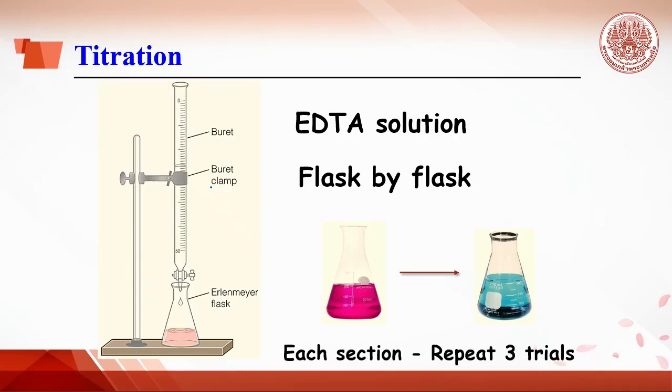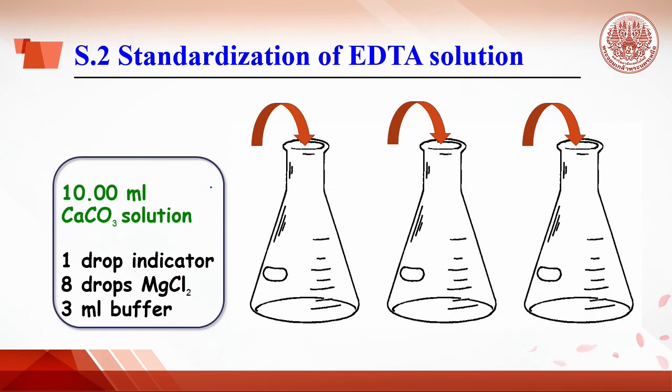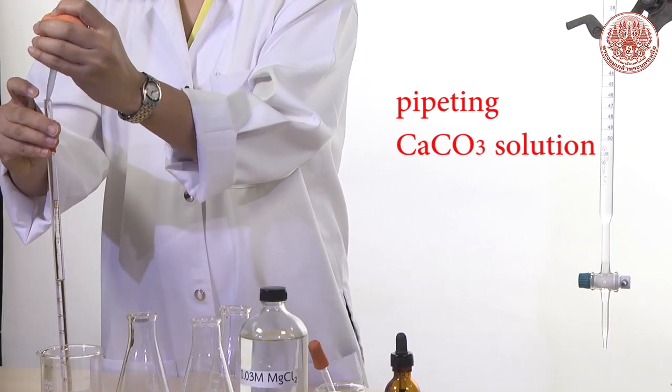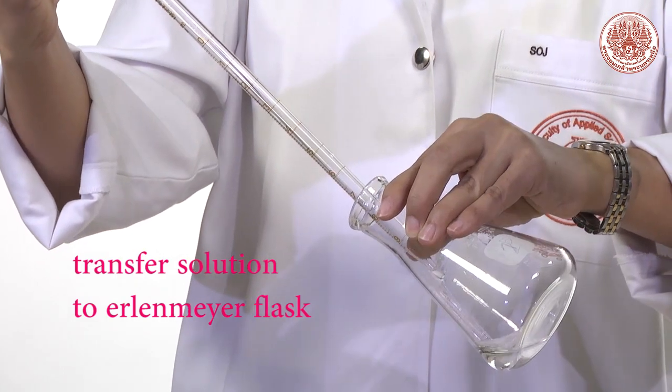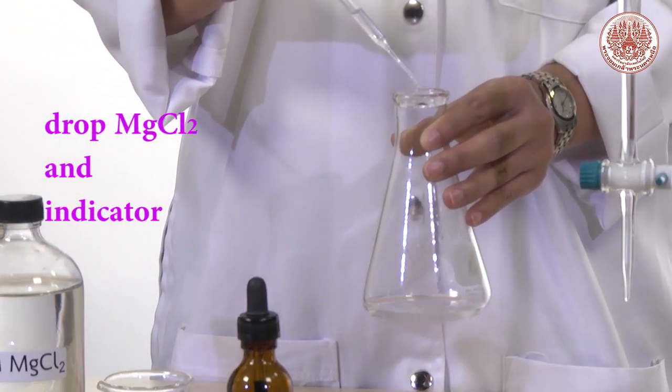In section 2, standardization of EDTA solution, do the same thing as section 1, but replace distilled water with calcium carbonate solution, which is primary standard.